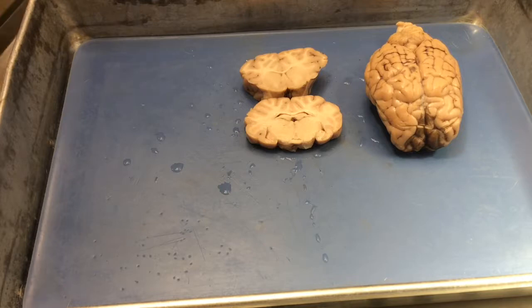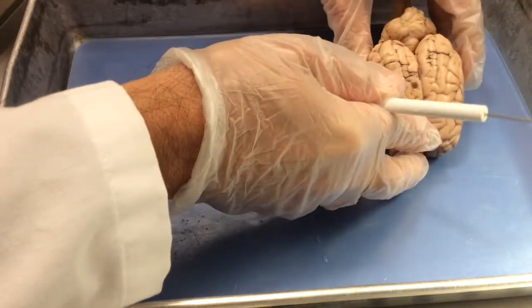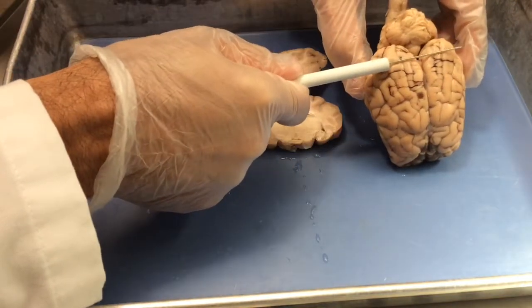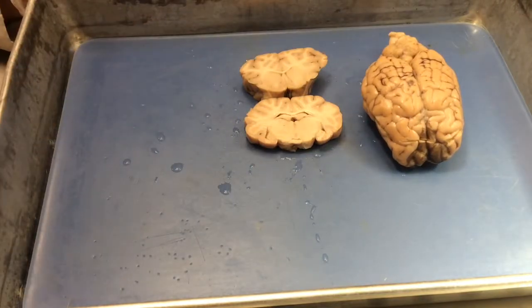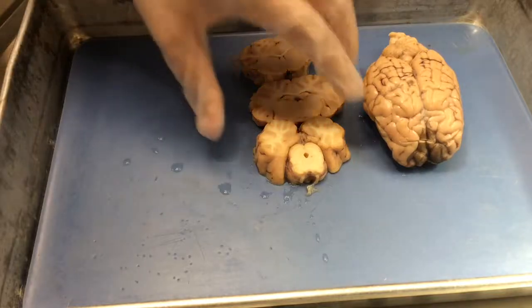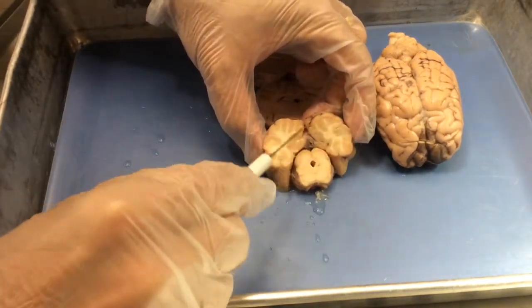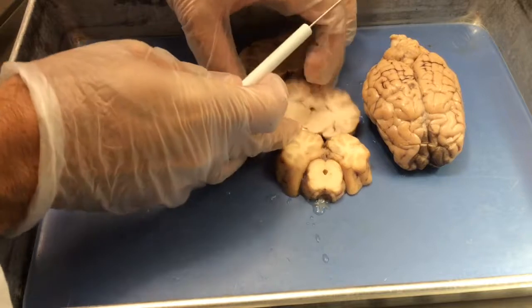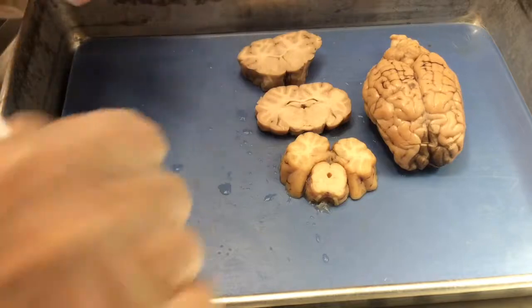is basal ganglia. As we go more posterior and now make a sort of coronal section through the occipital lobes of the brain, down through the front part of the cerebellum, and down into the brainstem area, then we'll get midbrain. And so here's our third section as we move back. This is midbrain. And you can see now it looks very different. The cortex is sort of separated from the brainstem region, whereas before the subcortical forebrain was connected to the cortex.